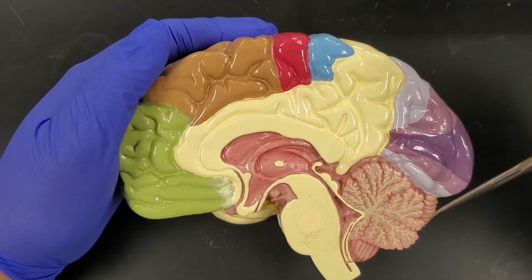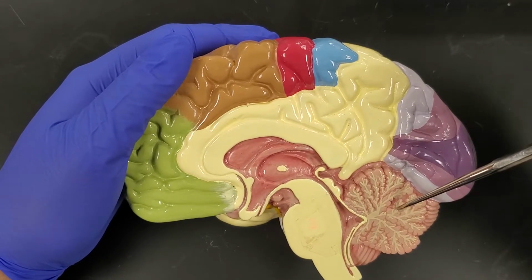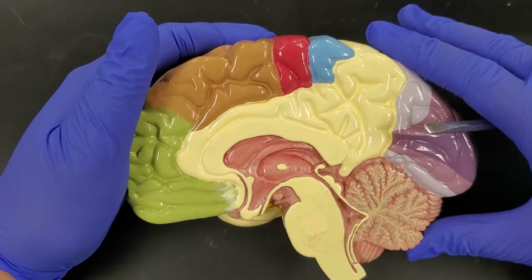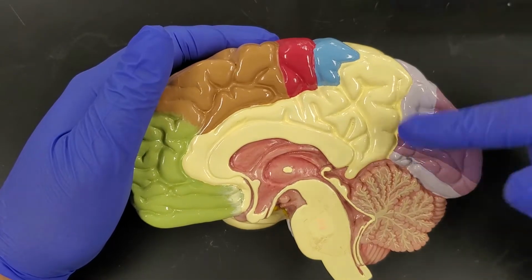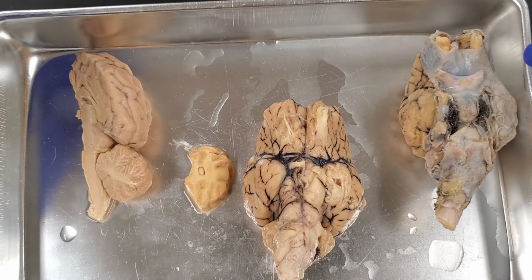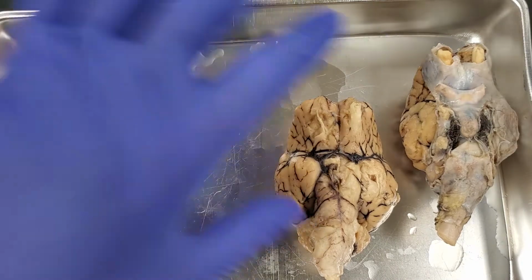So the first thing I want to mention here is when we look at the cerebellum down here, you'll notice that the cerebellum makes up about 1/5 of the overall size of the brain. On the sheep, it's a lot bigger. And so the sheep are basically going to use their cerebellum for more. So let's get into the actual brain itself. When we're looking at the brain, I basically have 4 different parts. I have 2 full brains, I have a dissected brain, and then I have a section of the brain.